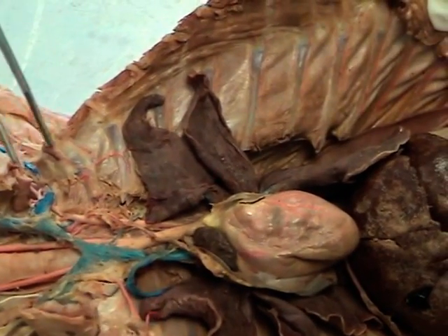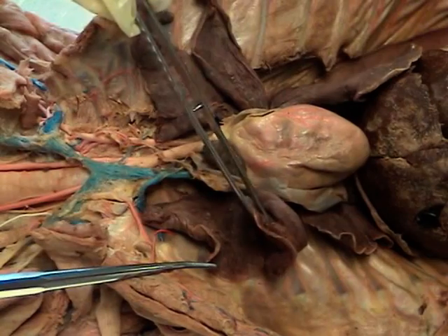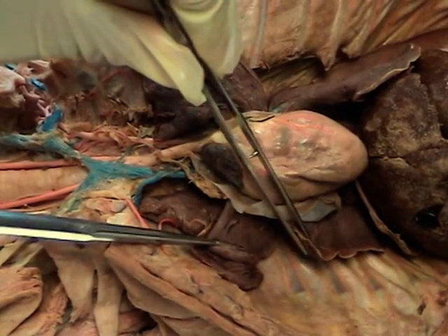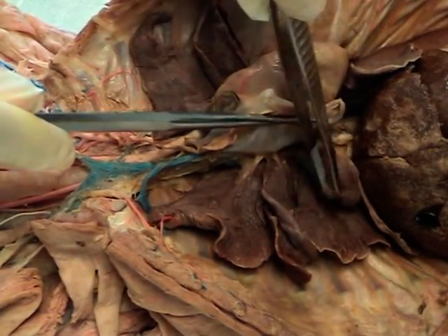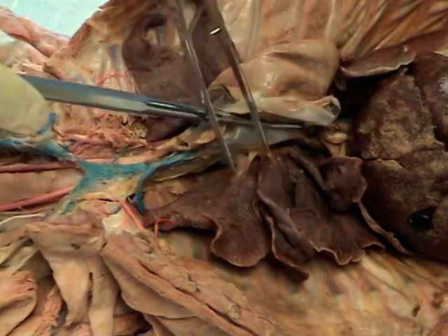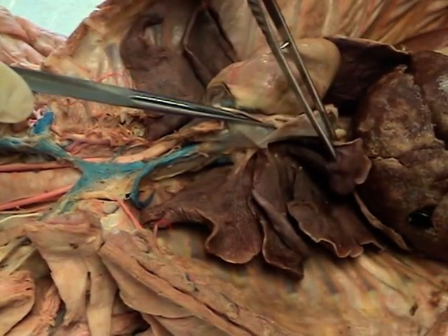On the right side of the lungs, we have four lobes. This would be the anterior lobe, then we have the middle lobe, then we have the posterior lateral lobe, and if you move the heart a little bit, you will see another lobe hidden way back here — and this will be the posterior medial lobe — otherwise known as lobe number one, lobe number two, number three, and number four.